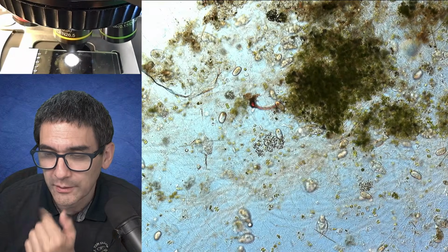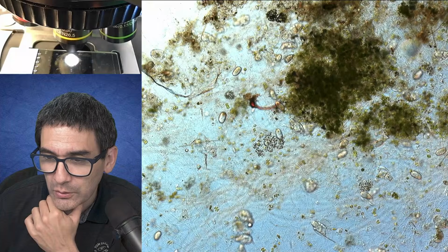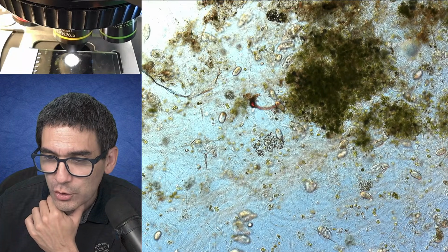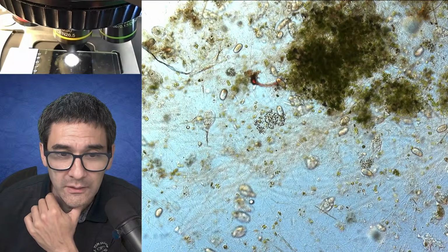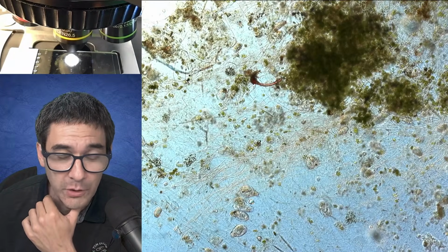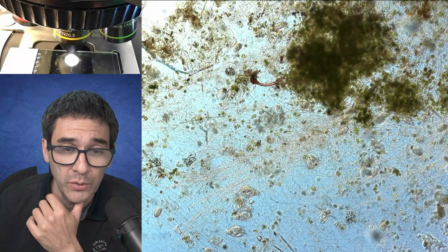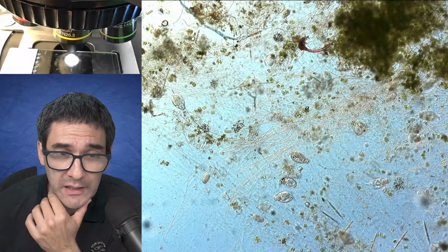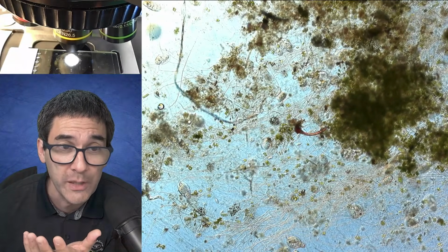Oliver, I'm just reading the comments here. Oliver says, when making permanent slides of rotifers, it's difficult, because when they feel the slide is drying out, they enter a phase where they change their shapes into balls and it's kind of unrecognizable. Yeah, this is generally a problem, and I also uploaded very recently, a couple of days ago, another video where I tried to make a permanently mounted slide of a sample like this, and you have to dry it, and then of course the organisms lose their shape.